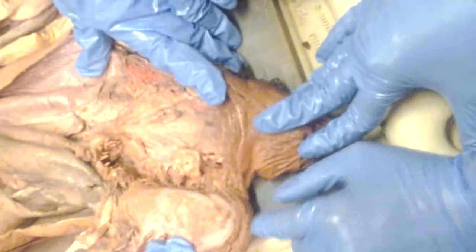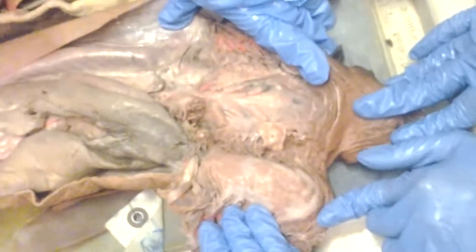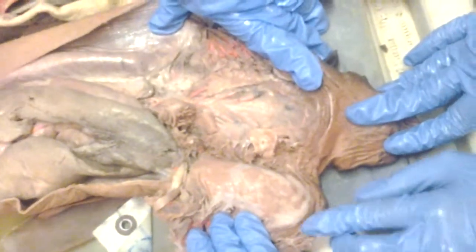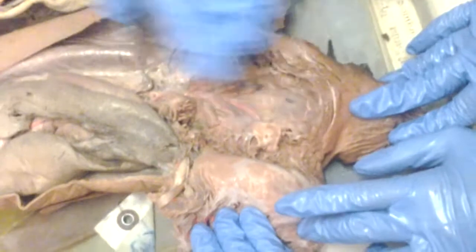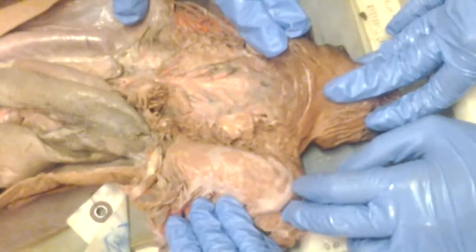What are the dermal denticles? That's the skin. I thought it would be something with the teeth. No. Denticle means tooth because it looks like teeth. Where is that? That's all over the skin. It's the one that you showed us under the microscope. Spiracles, yes.